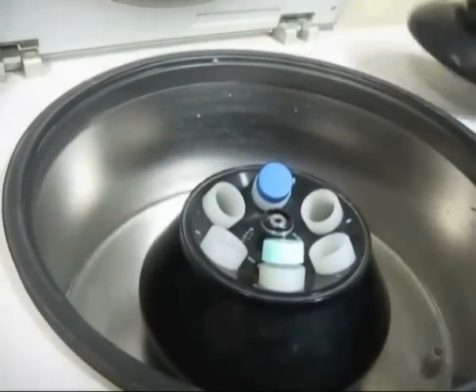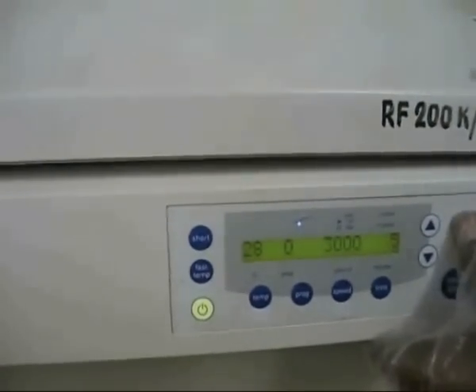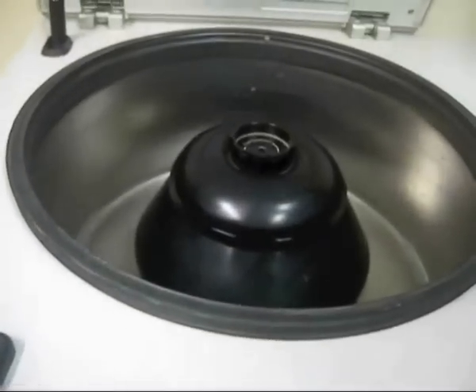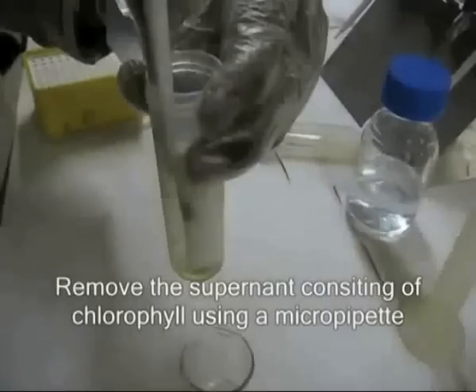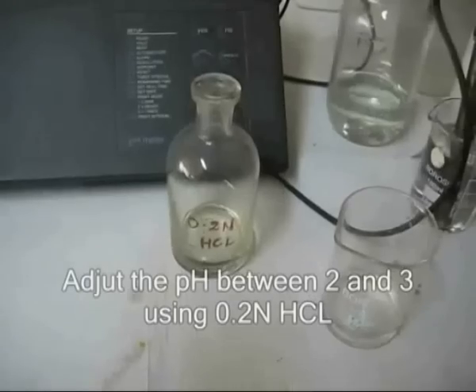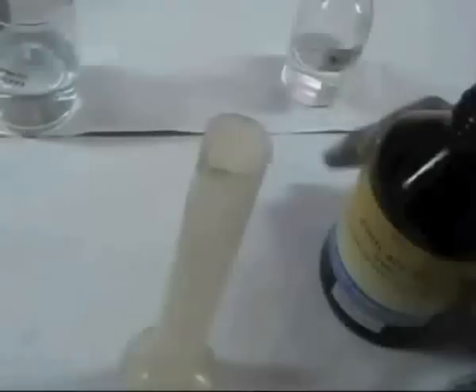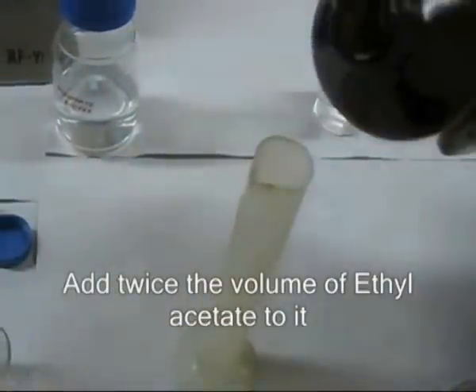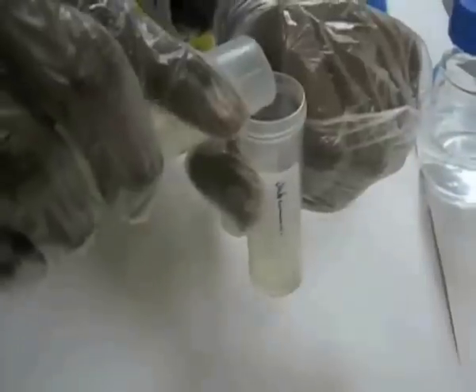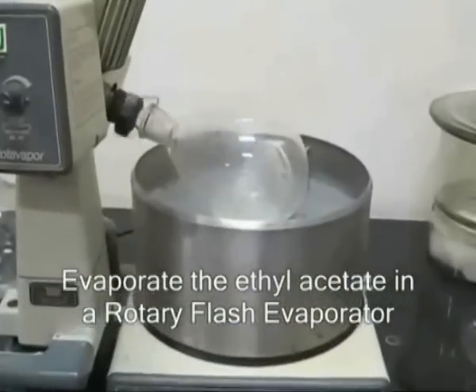Centrifugation is to be done at 3000 rpm for 5 minutes to settle down the ethyl acetate. Chlorophyll is seen as a separate layer and is to be pulled out. Rotary evaporation is to be done to remove traces of ethyl acetate.